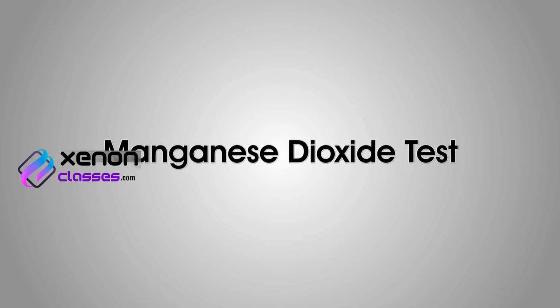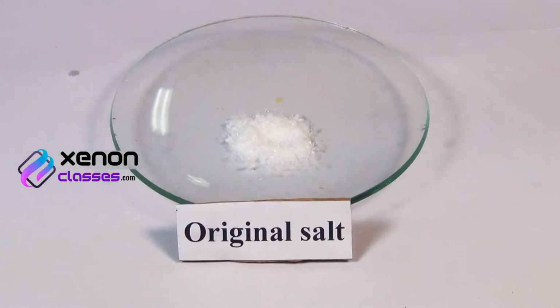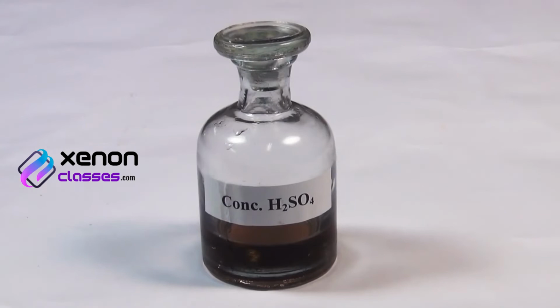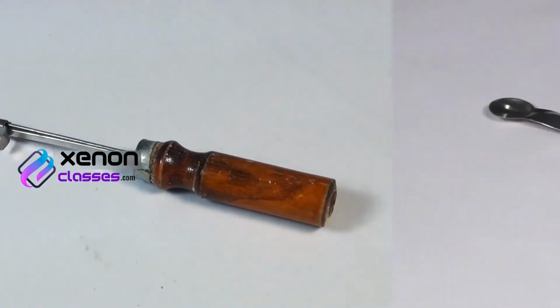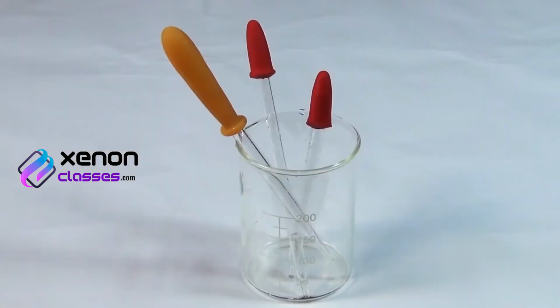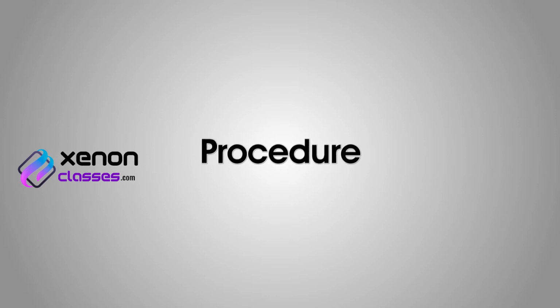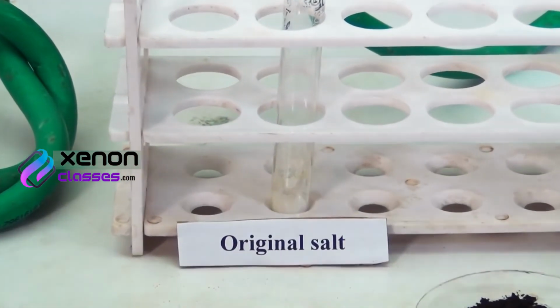Manganese dioxide test. Materials required: original salt, manganese dioxide, concentrated sulfuric acid, test tube holder, spatula, dropper, and a Bunsen burner. Procedure: take a small quantity of the salt in a test tube.